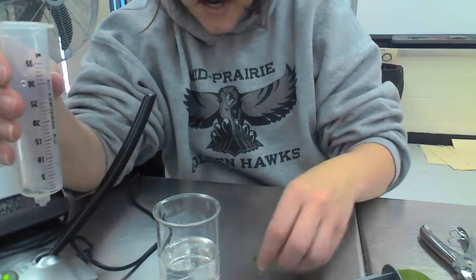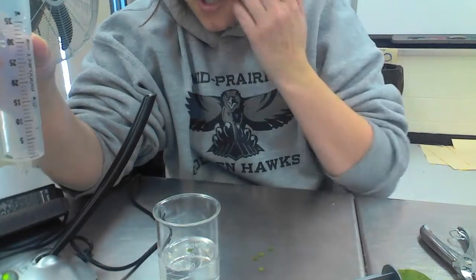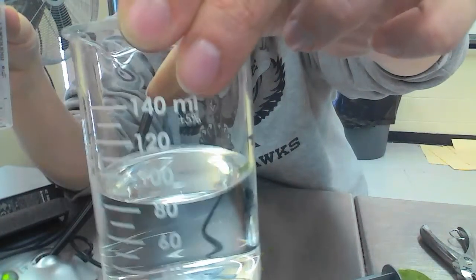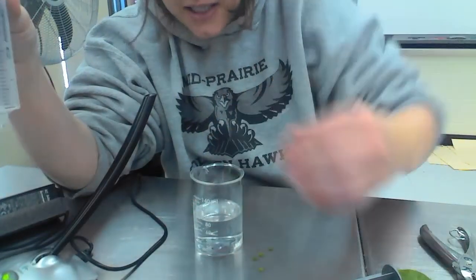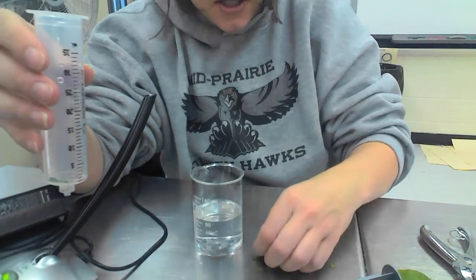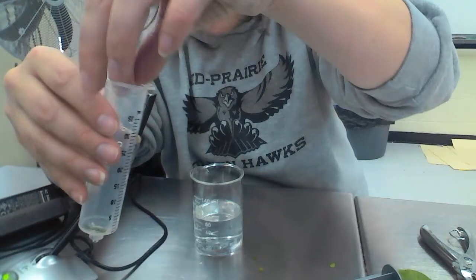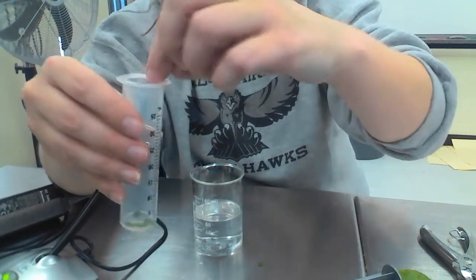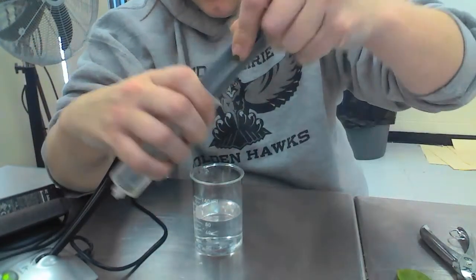And here's the reason why. If I put a chad, or a piece of spinach leaf, into the water, you'll notice that it's floating on the top. I don't know if you can see that very well. It's floating on the top. We don't want them to float. We want them to go to the bottom so that we can see photosynthesis actually occur. So we need to get all the air out of our leaves. Leaves actually have air pockets in them, so we need to make sure that all the air is out so that they will sink. All right, so I went ahead and put all of the chads into our syringe.